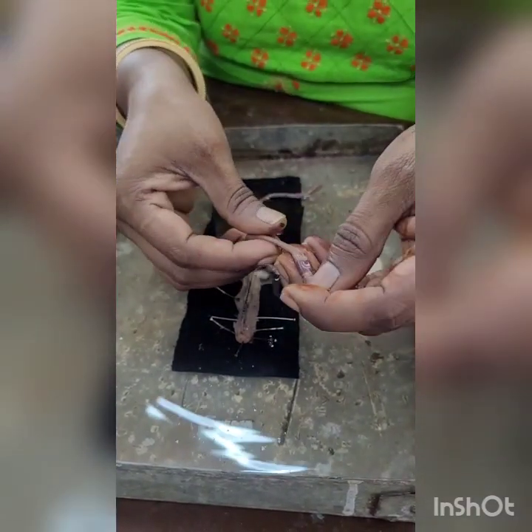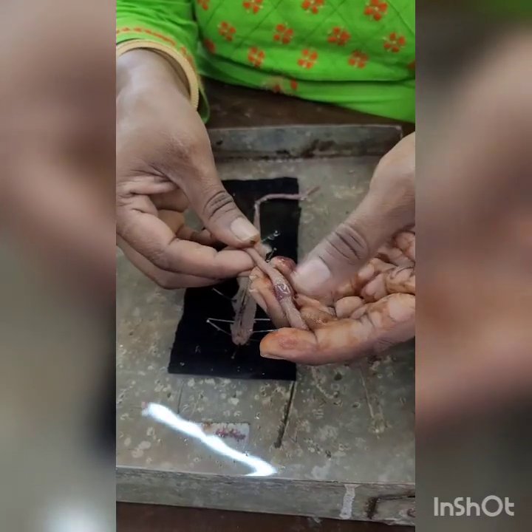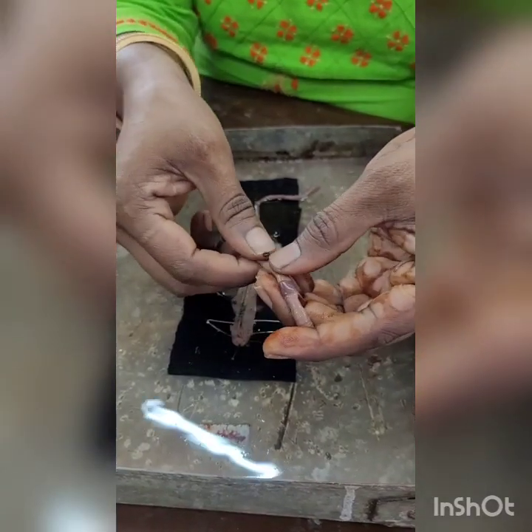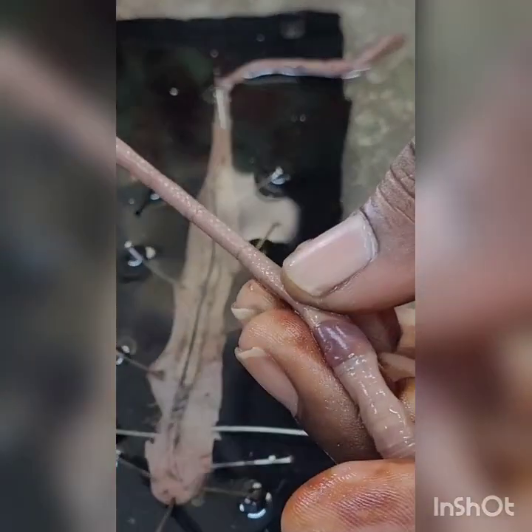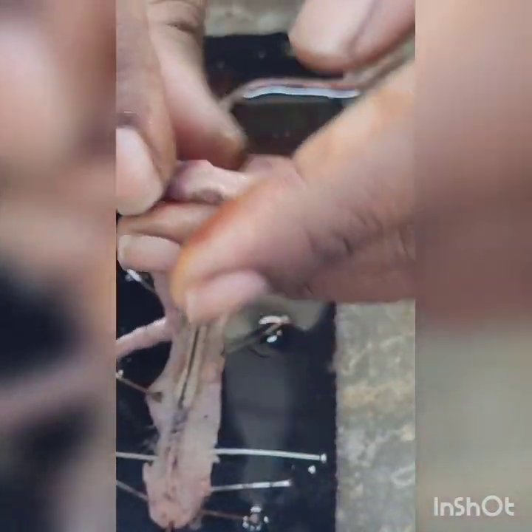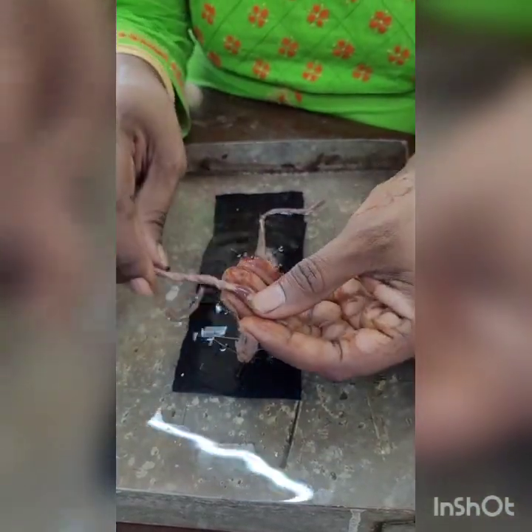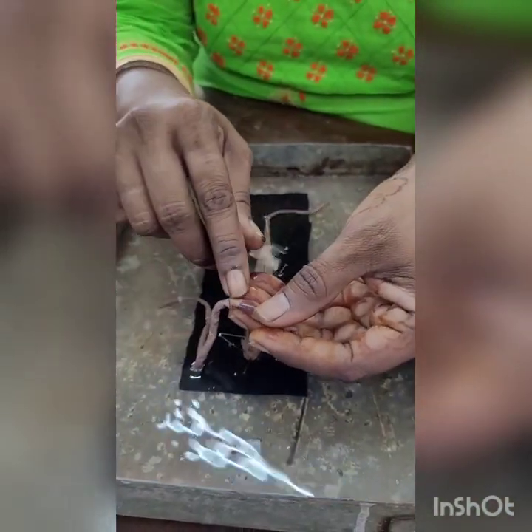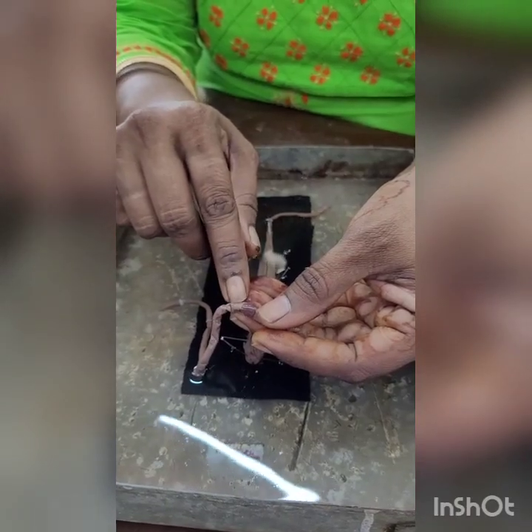On the dorsal side, you can see the dorsal blood vessel — the black vessel running along the body. On the ventral side, you can identify it by checking the pores present just below the clitellar region.